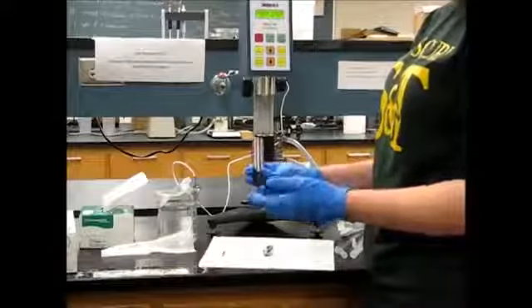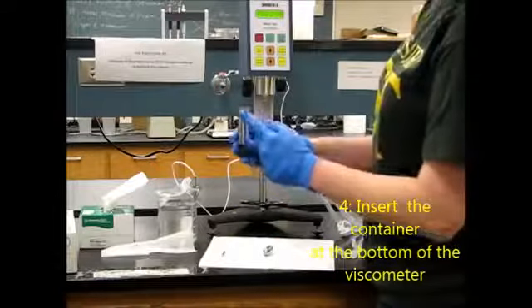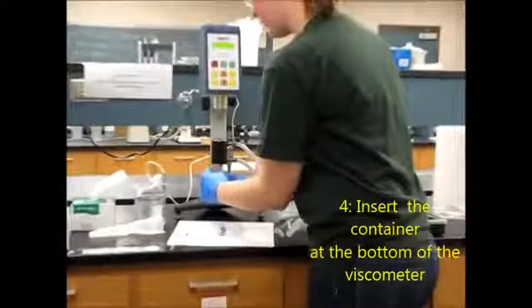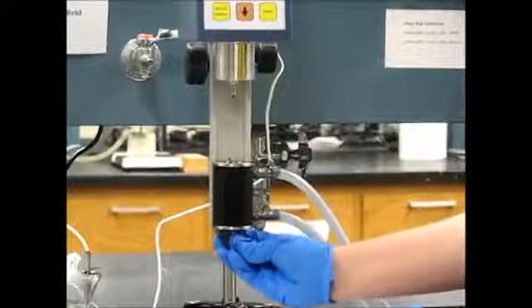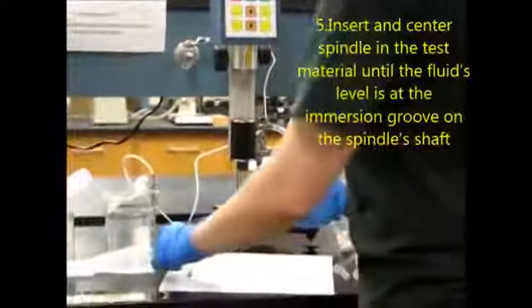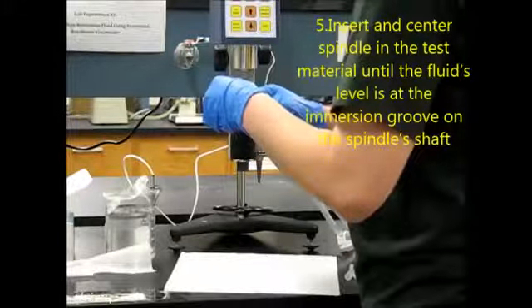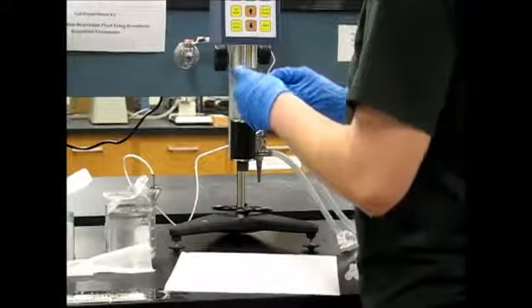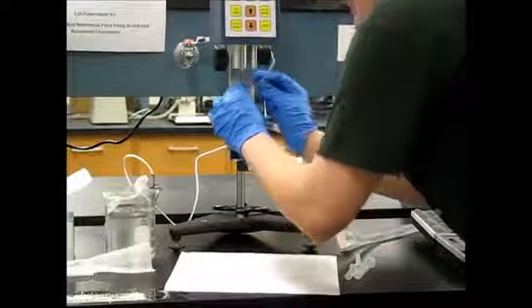So now that our sample container is around 25% full, we're going to go ahead and attach it. There's a little groove which you want to match up with the inside of this container. So we're going to place it below, push it up until the grooves match together, and then lock it in place. So now our sample container won't go anywhere. Then we're going to take our spindle and slowly place it in the sample container.